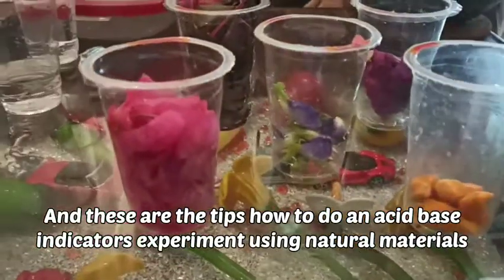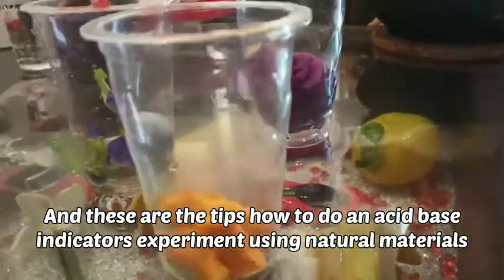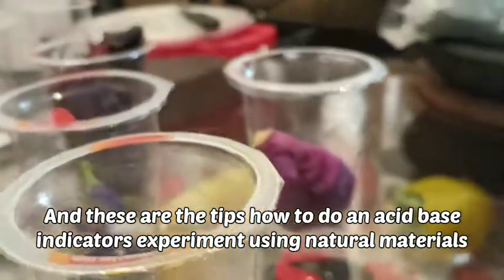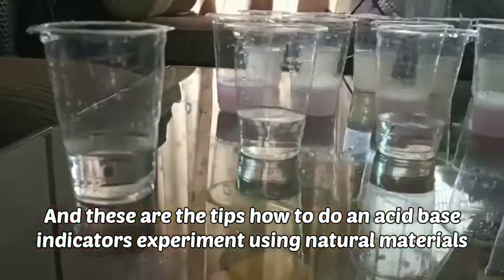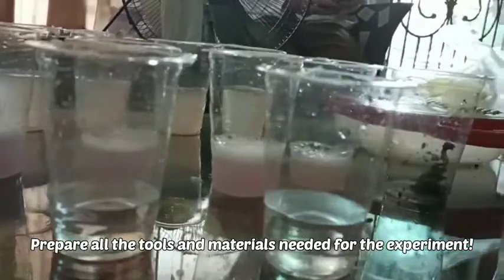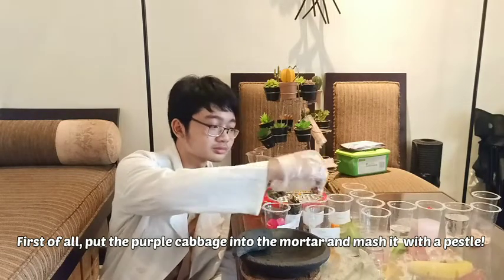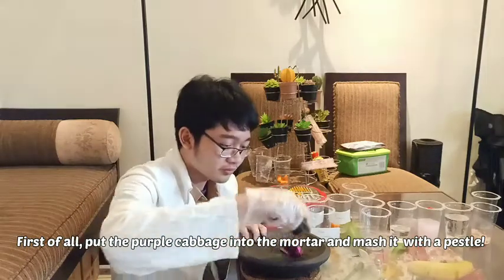And these are the steps for how to do an acid-base indicator experiment using natural materials. Prepare all the tools and materials needed for the experiment. First of all, put the purple cabbage into the mortar and mash it with a pestle.